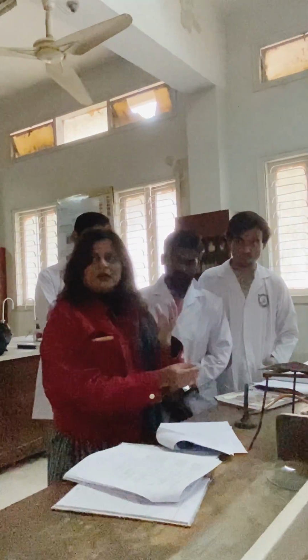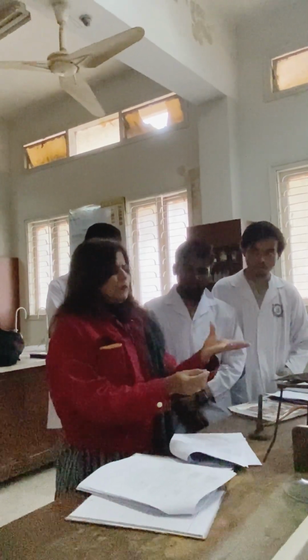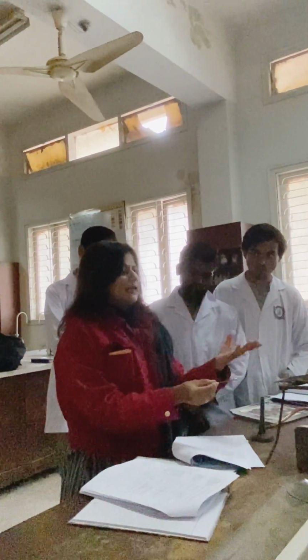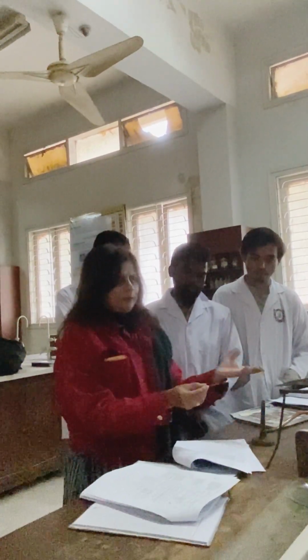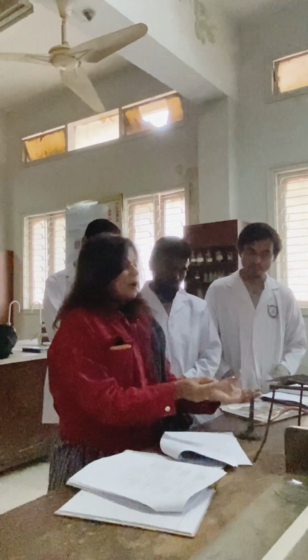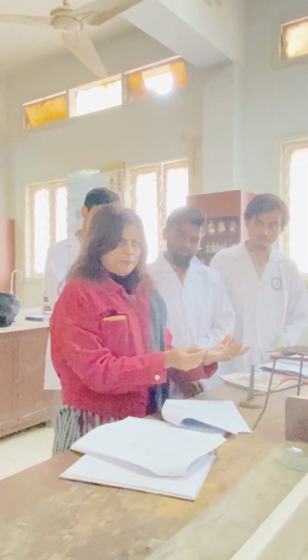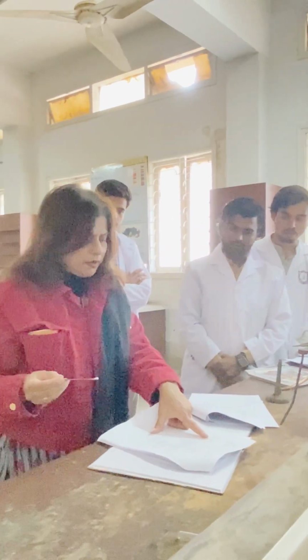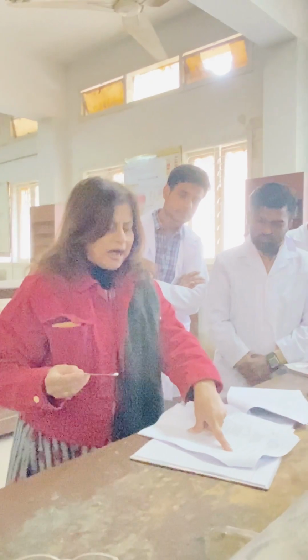Now, you are going to observe the color of those fumes. I told you in my demo, if you have white fumes, we suppose them as white, so it's an aliphatic compound, right? But if it has dark colored soot, that means it's an aromatic compound. You will write down over here: burn with a sooty flame, or aromatic, or highly unsaturated.